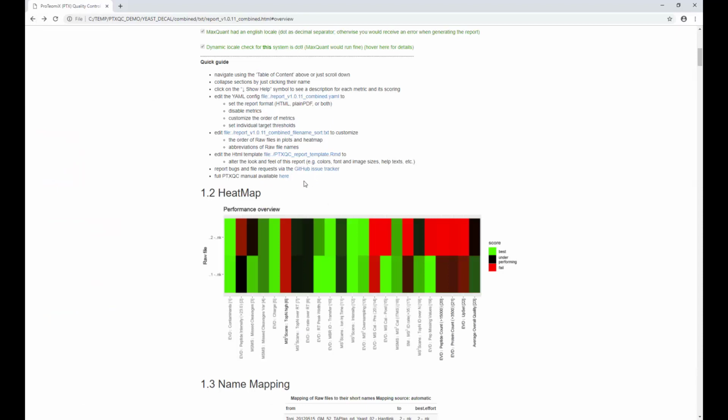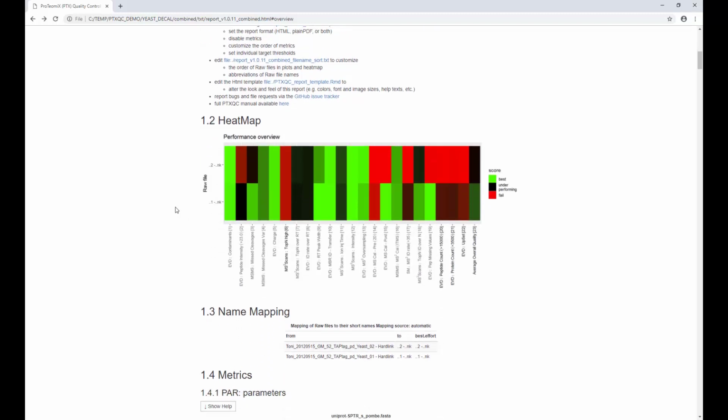Okay, then if you find a bug, something that you're not happy with, there's a direct link to the issue tracker on our GitHub homepage, so you can file an issue there, or if you want to have a look at the full manual, it's also linked here. Okay, now let's look at the actual data that PTXQC produced. The first thing that you're always going to want to inspect is the heat map. The heat map consists of all the metrics which are automatically scoreable by PTXQC, and on the y-axis you're going to see all the raw files that MaxQuant processed.